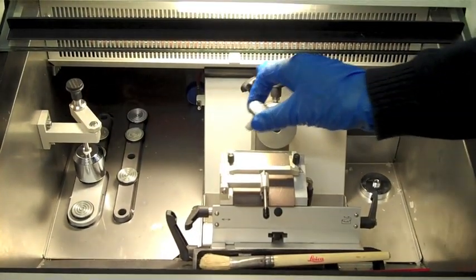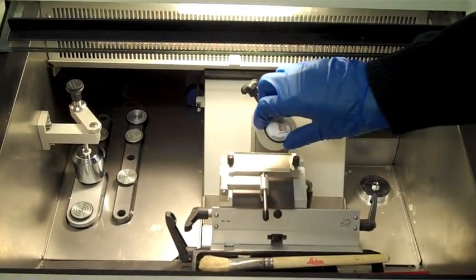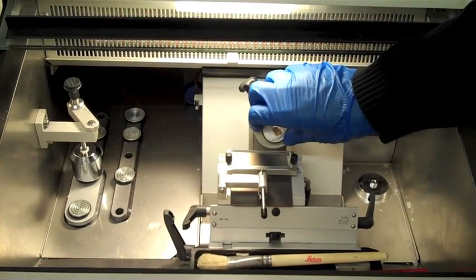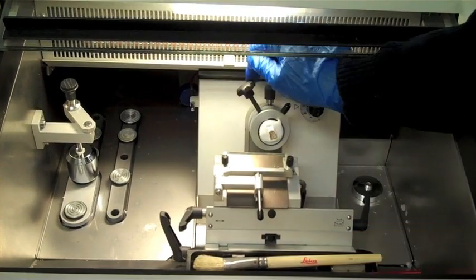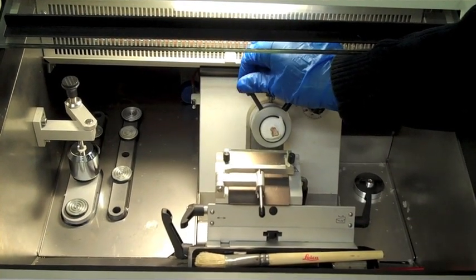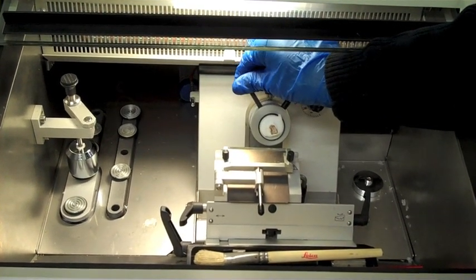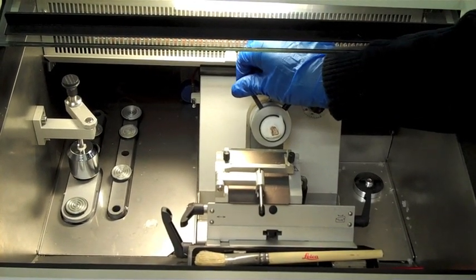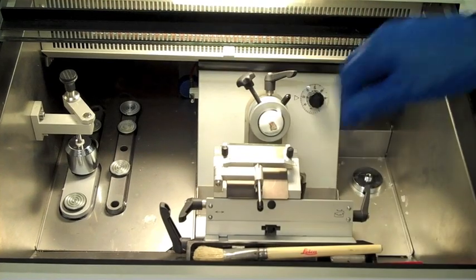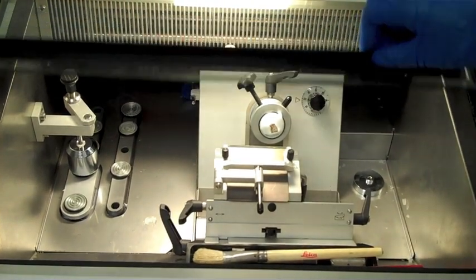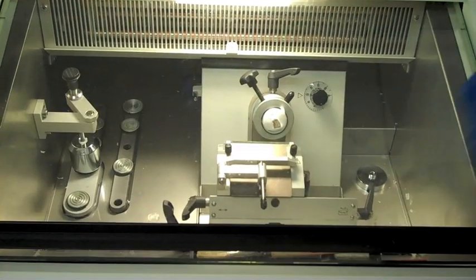Mount the chuck onto the specimen holder. Be sure to tighten the disc using the knob. Make sure this knob and all others are tightened fully before cutting your specimen. This will reduce chatter.